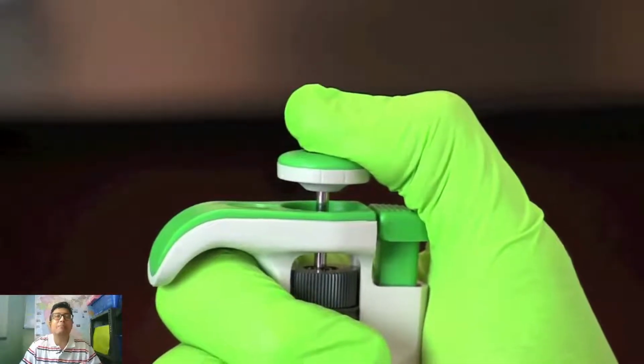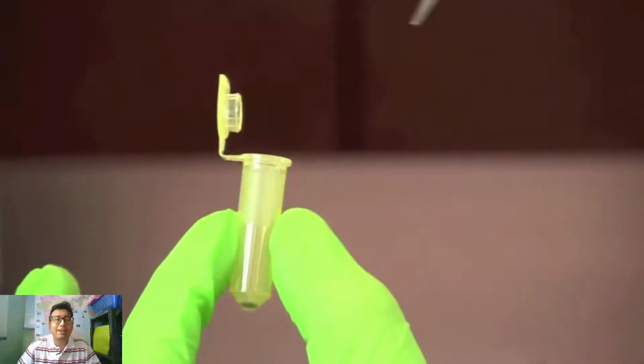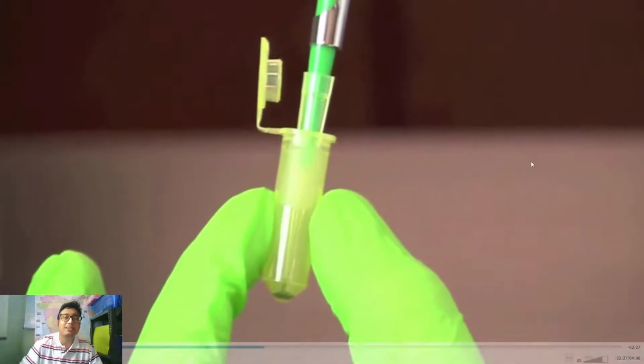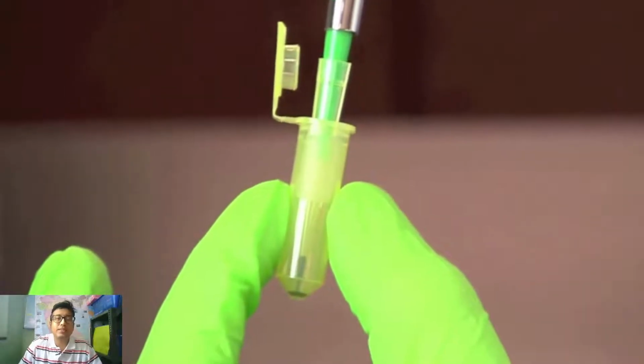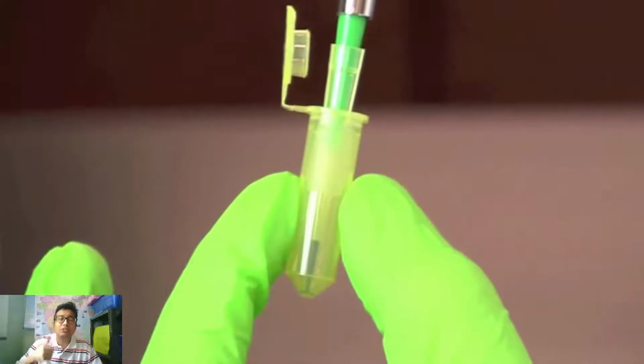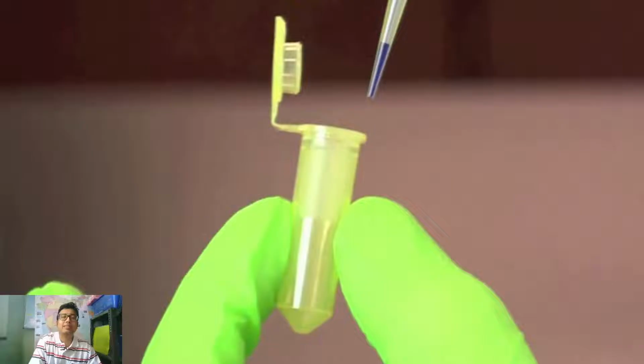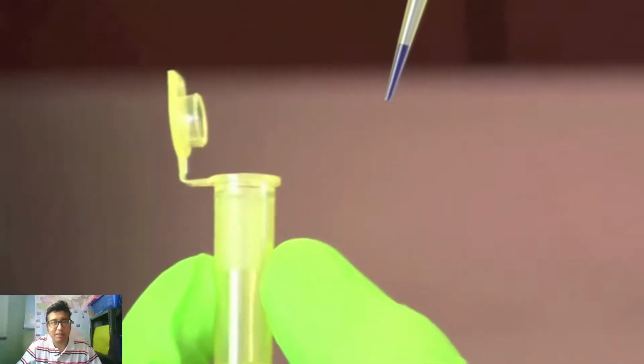So, the DNA sample will look like a black dot because a small amount of DNA sample has already been mixed with the dye. You need to press the plunger, okay, and then pick up the sample. Agarose gel already has wells, okay, there are small holes in the agarose gel that are made with the help of a comb, okay, the comb with which we brush our hair.